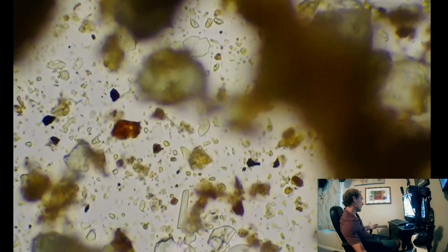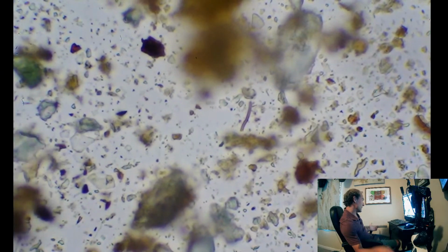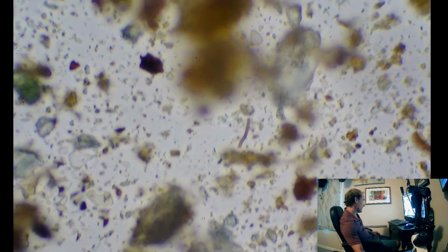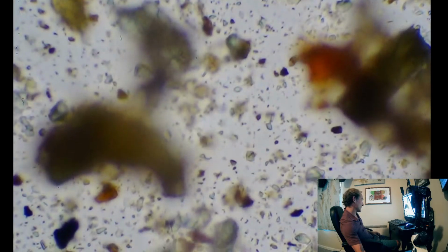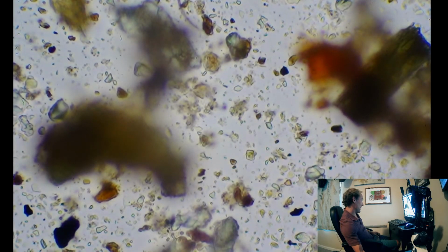But yeah, when was the last time you saw a fungal hyphae? Oh, there's one. Little piece. Nice brown looking one, but far from a... I don't know, what would we give this for a fungal to bacterial ratio? Whole lot of bacteria.